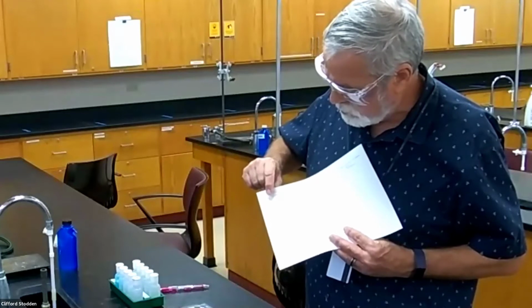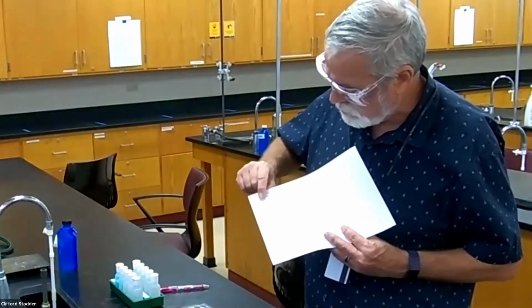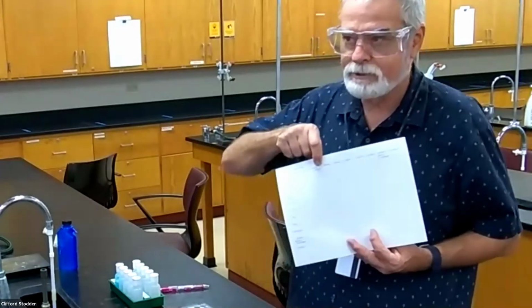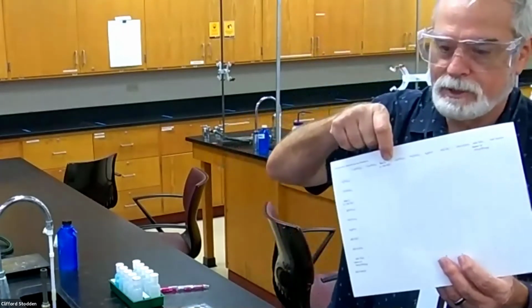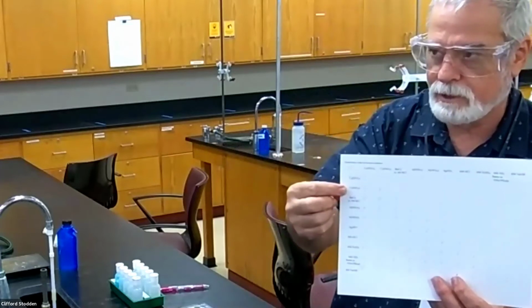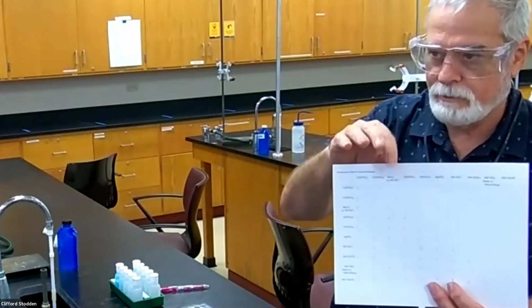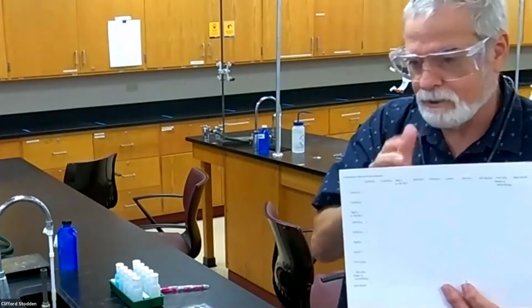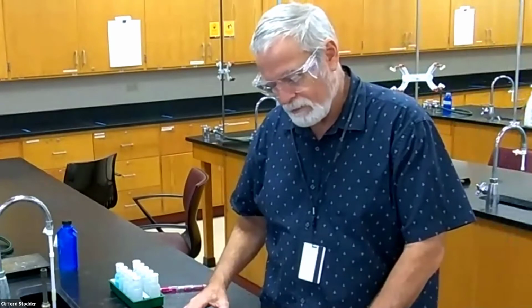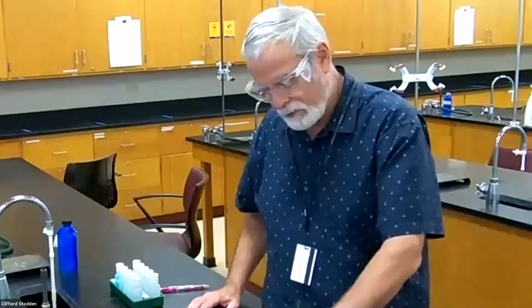The next one, I'm just going to go across with the calcium here this way. So the next one will be calcium with barium chloride. Now for that one, something could happen because barium has a different anion than the calcium does here. Okay, so over here the barium has a chloride anion. That could possibly form a precipitate with the calcium. So we'll see if it does.